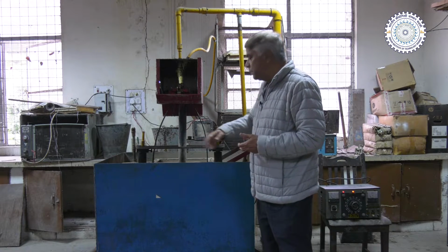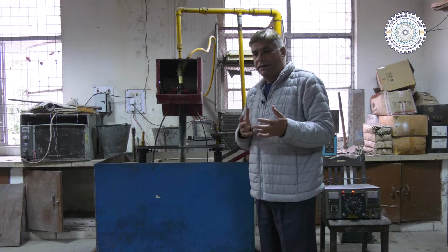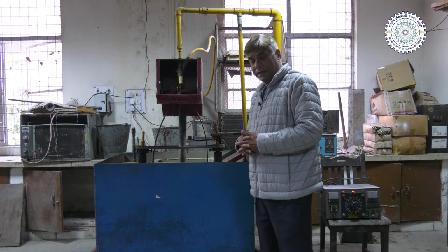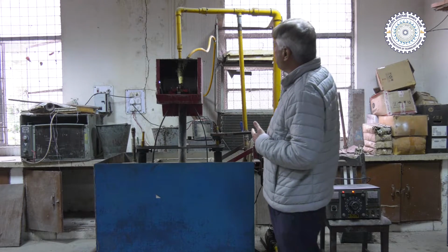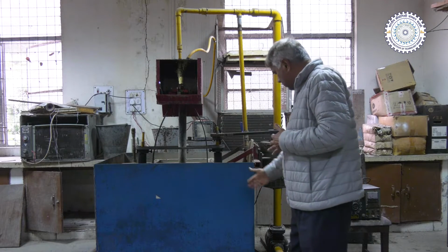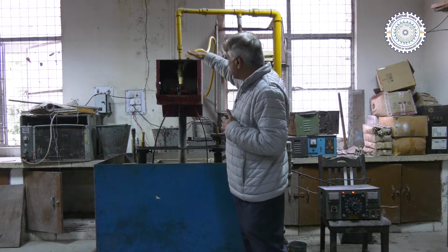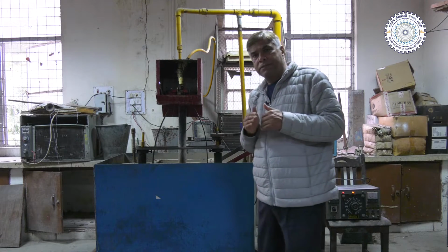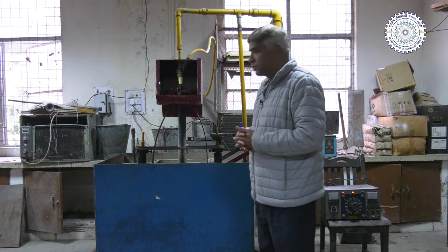So we continue to stir the slurry so that there is uniformity in the distribution of the eroding particles in the slurry, and this slurry is then pumped and forced to pass through the jet. So here there is a motor which will be circulating the slurry through these pipings, and then the slurry is forced to pass through the nozzle. So when the slurry is passed through the nozzle at a high pressure, we certainly get the higher velocity of the jet which is coming out.